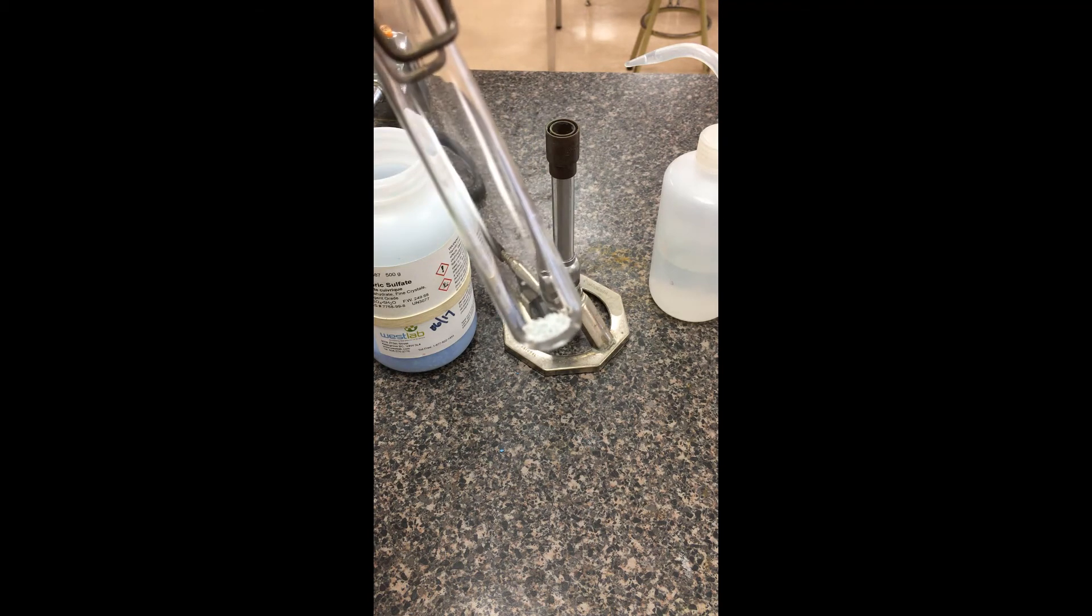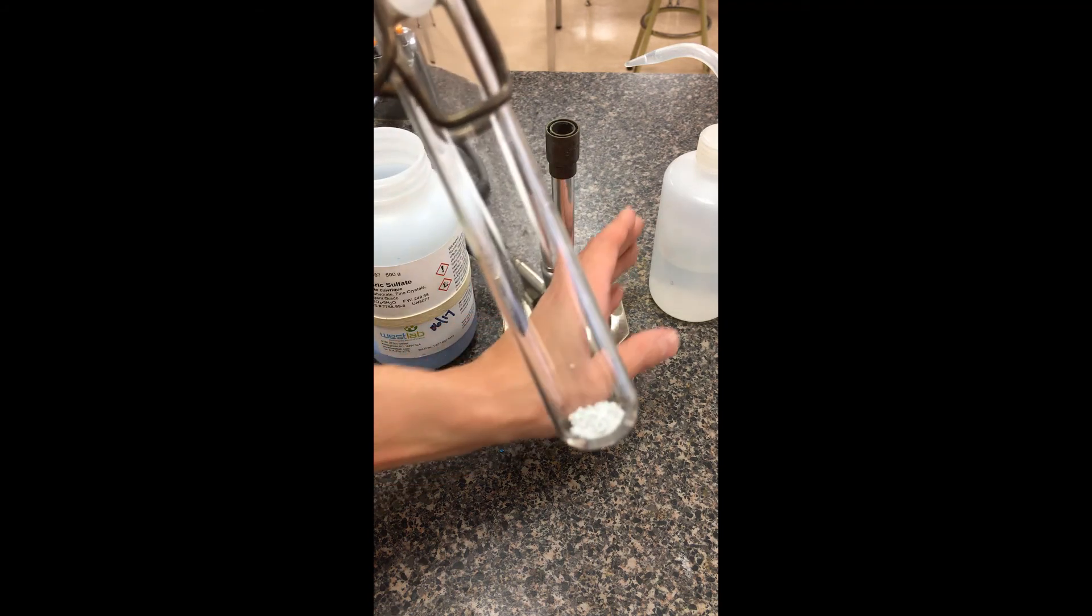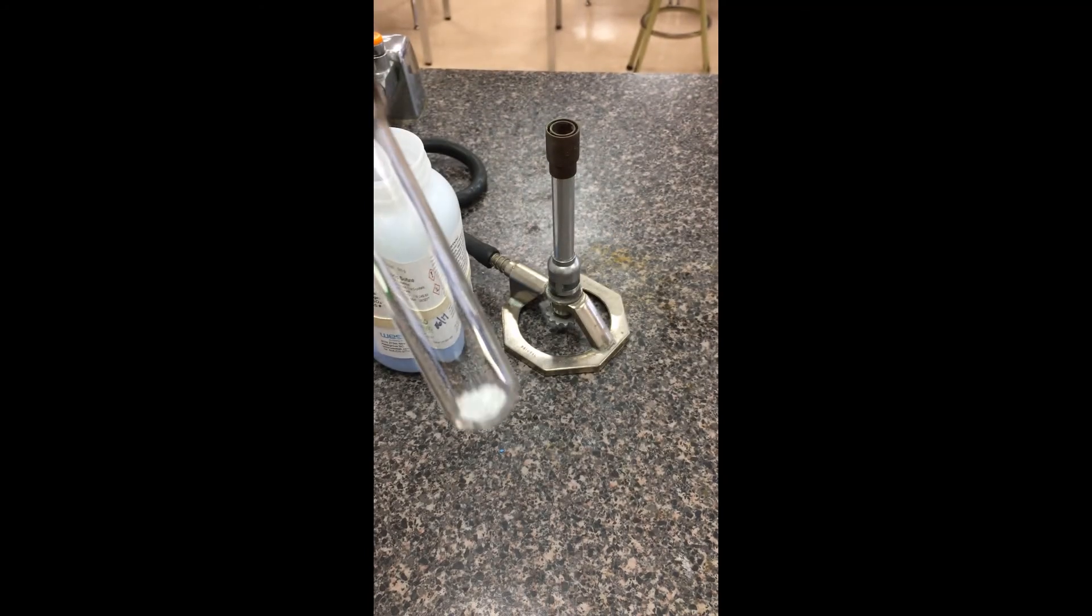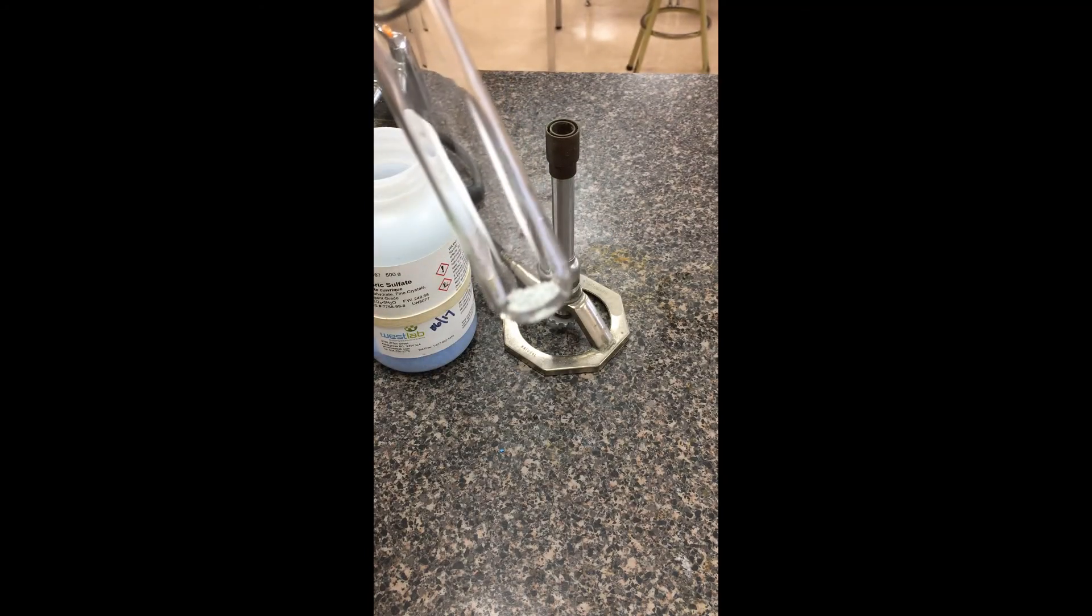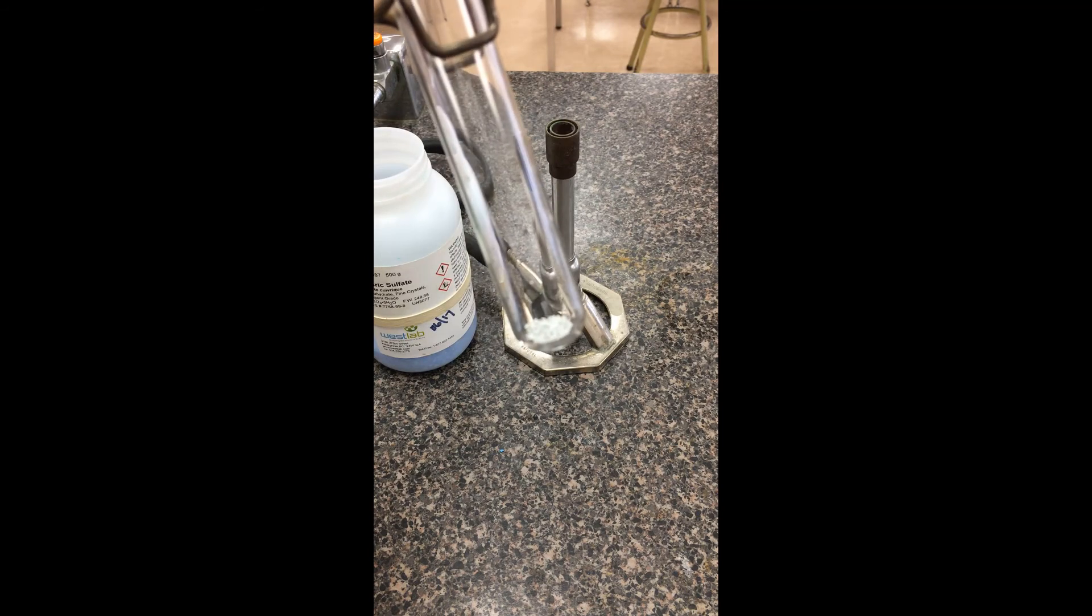So, this will probably still be a little bit hot, okay? But once it's cooled down a bit, what I'm going to do is I'm just going to take some water from the squirt bottle, and then we're going to just see what happens to the powder before it actually becomes a solution.